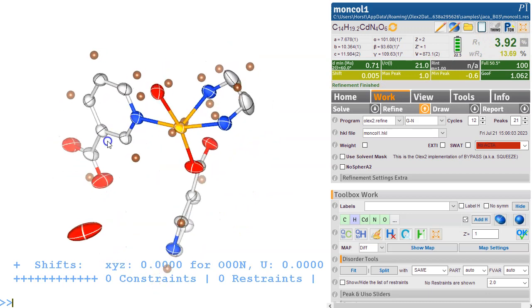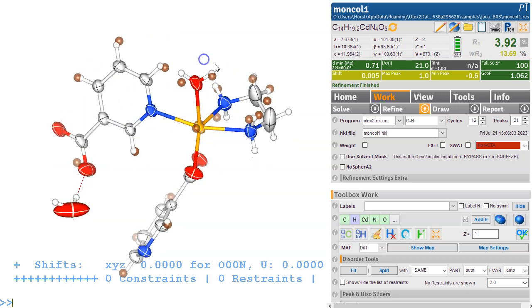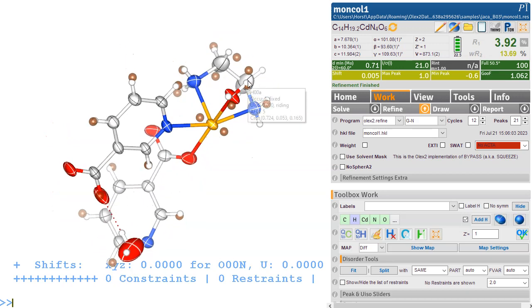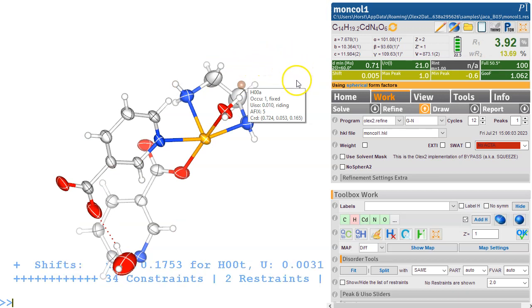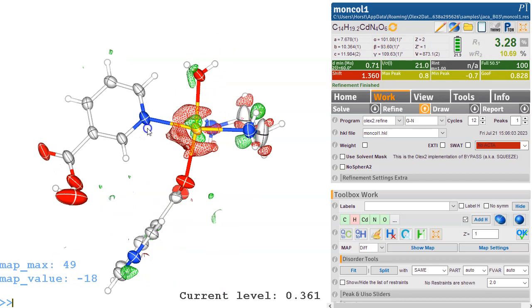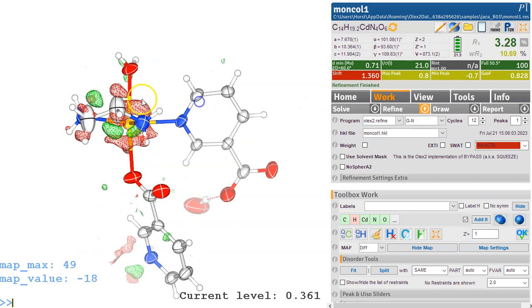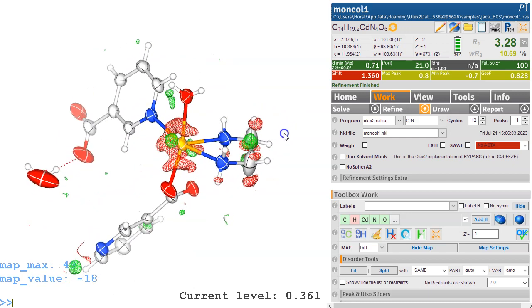3.92% R factor. We can see all these hydrogen atoms here. So a standard HAdd will probably do a good job in adding all of these hydrogens here. Let's refine it a few times and see where we end up. Right. Okay, so we have virtually nothing left here. However, that all looks very clean here. There is clearly some disorder going on in that CH2 thing here.